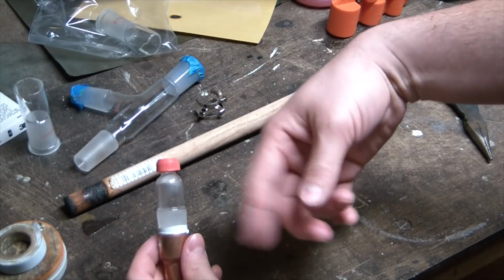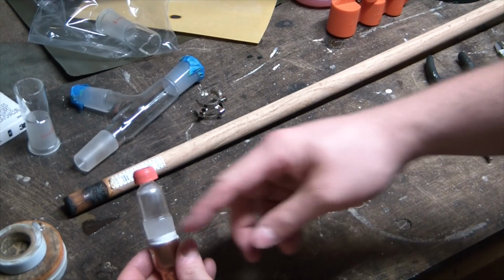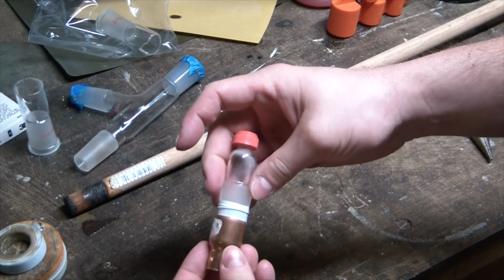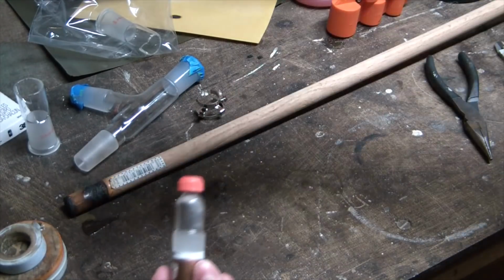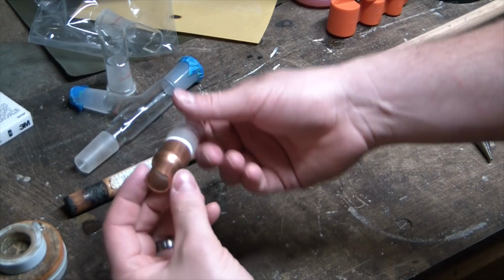The nice thing about the PTFE too is it makes up for the expansion differences, because copper has greater thermal expansion than the glass. So once it heats up, I can probably just push it in a little further. Nice tight seal. That should be fine. And of course, PTFE tape is completely chemically inert, at least to ethanol fumes. So I think this is the solution I'm going for.